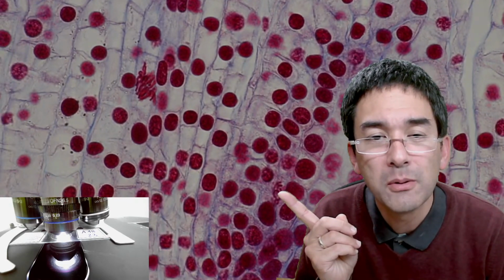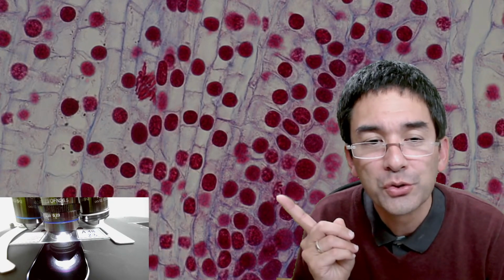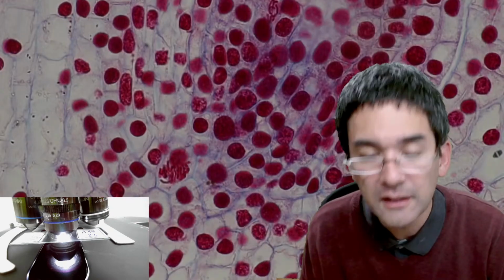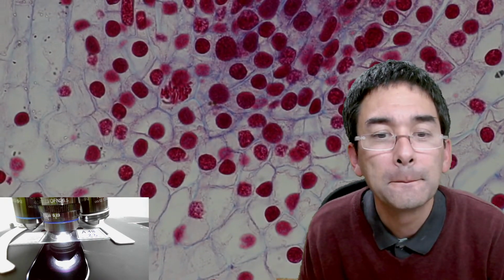Also over here, you see, I don't know what stage this could be, maybe also prophase, but you see over here also chromosomes visible. Oh, I bumped again into my microphone. So it does require patience to see all these things.